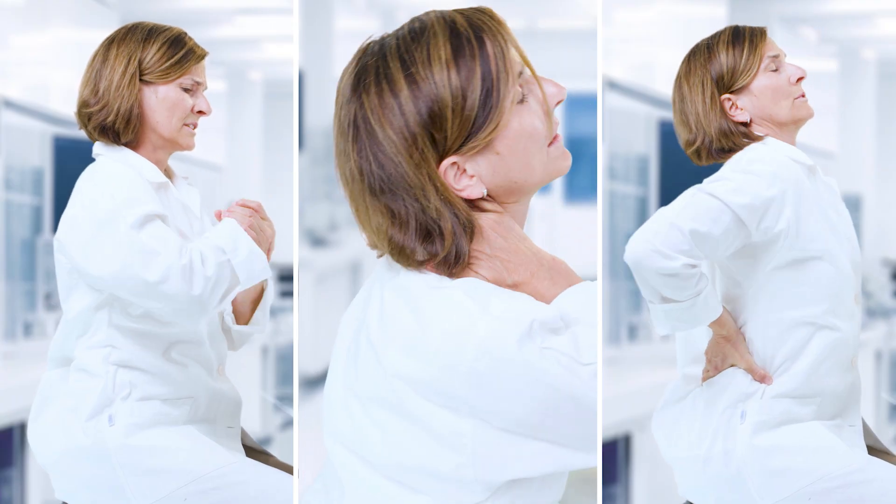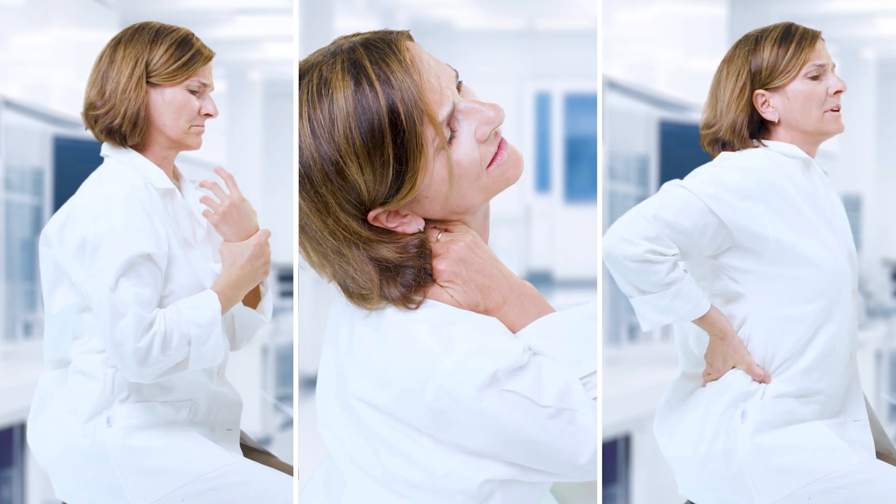By following these steps, you can create a comfortable microscopy workspace that can prevent arm, neck, and back pain. It will help you to work efficiently throughout the whole day.